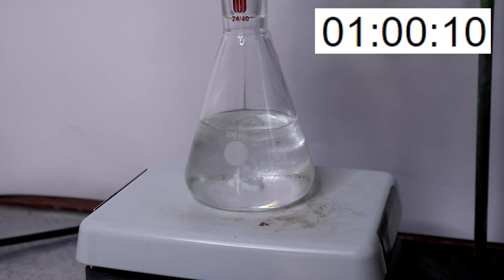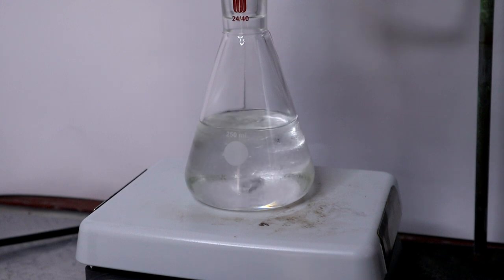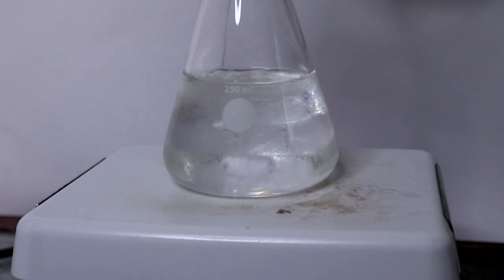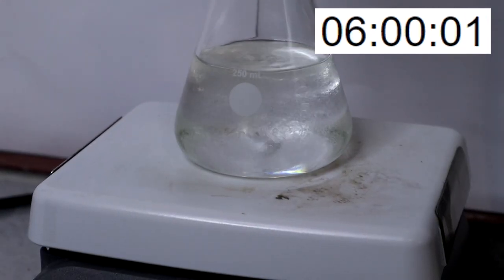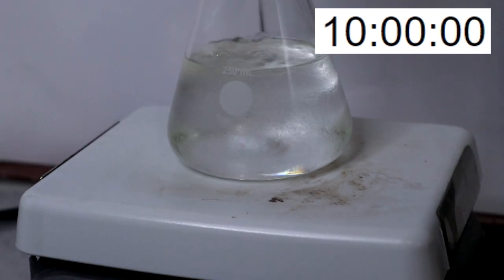Nitric acid will not work, however, and the reaction is said to evolve copious amounts of gaseous products consisting of carbon dioxide and nitrogen oxides. Another data to note is that if concentrated sulfuric acid is used in this reaction, there may be highly toxic carbon monoxide involved during the reaction.